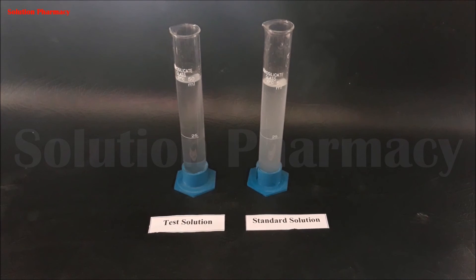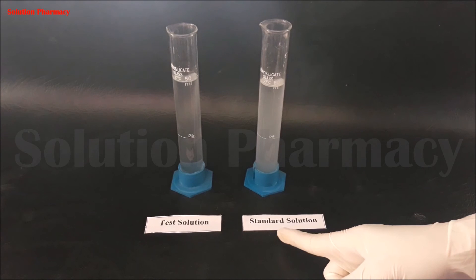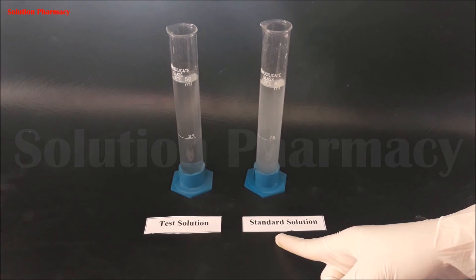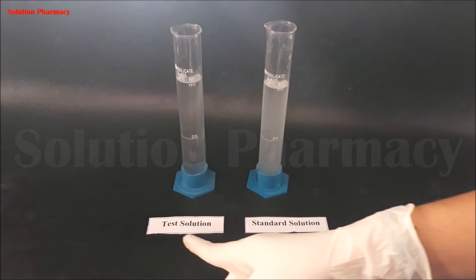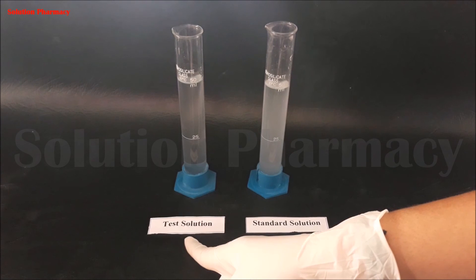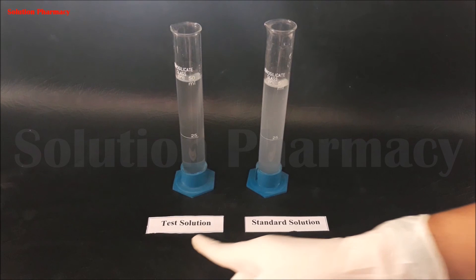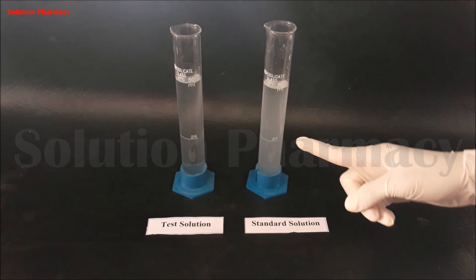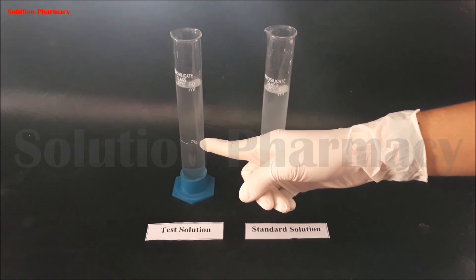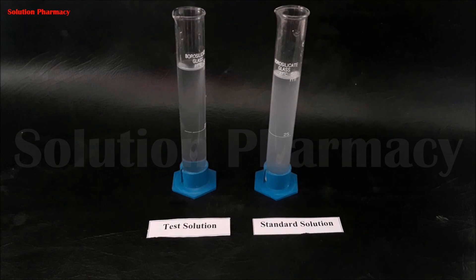Now observe both Nessler cylinders against a black background. The right side is the standard solution and the left side is the test solution. Both solutions are turbid. The turbidity of the test solution is compared with the standard solution. Here you can see the test solution turbidity is less than the standard solution, which means our sample passed the limit test of sulfate.